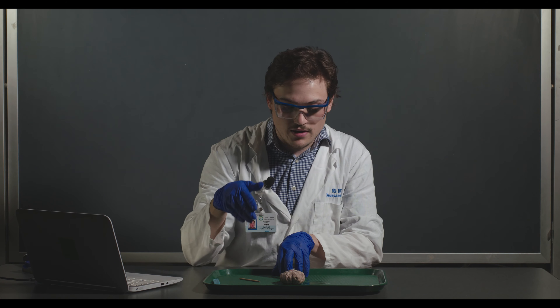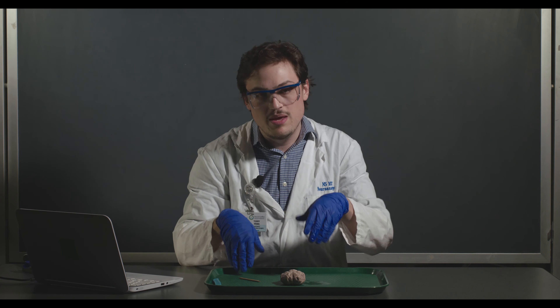On the meninges, there are three layers: the dura mater, which is the outermost layer; the arachnoid layer, sometimes called the arachnoid mater; and the pia mater, which is the innermost layer. These brains actually have the arachnoid mater and the pia mater still attached.